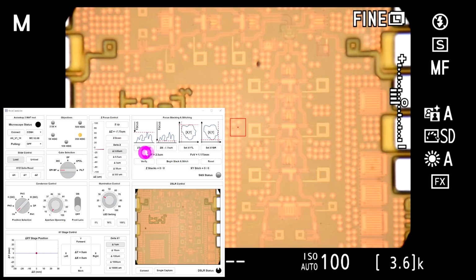So we have these two Z points. I'm going to verify to make sure this is correct. And it looks like it is. And it needs 21 pictures to focus stack here. I'm not telling it anything about moving the X and Y. It's not necessary. It's the same idea. And now we can go ahead and say, begin the stitching.